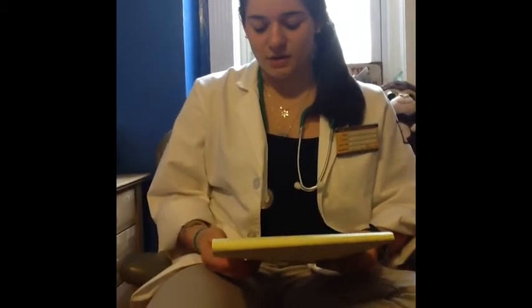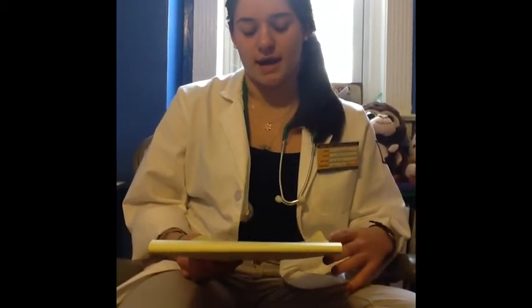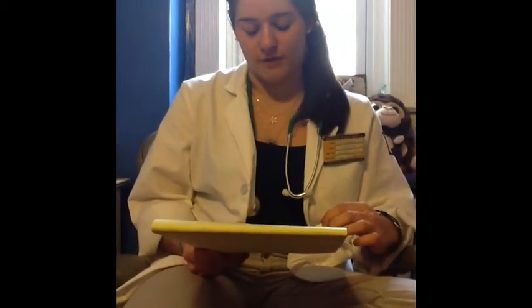The heart consists primarily of 4 chambers, the right and left atrium and the right and left ventricles. The aorta is the major artery of the circulatory system and contains blood under the highest pressure. The aorta is very thick-walled. Veins, in comparison, are very thin and contain valves so that the blood will flow only towards the heart and not travel to the legs because of gravity. Blood from the lungs drains into the pulmonary veins and is oxygen-rich. The main vein is the vena cava.